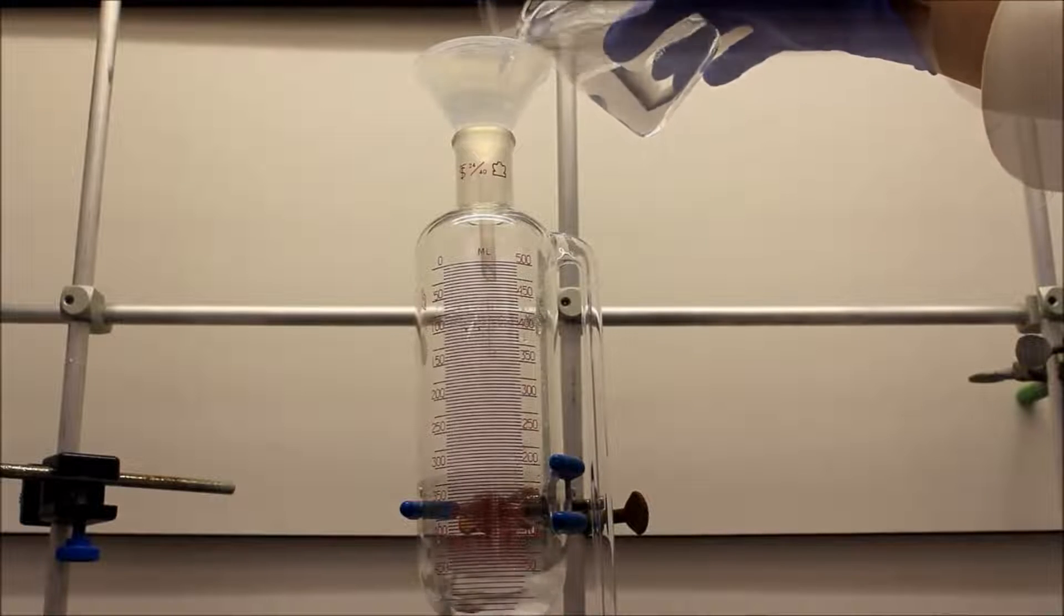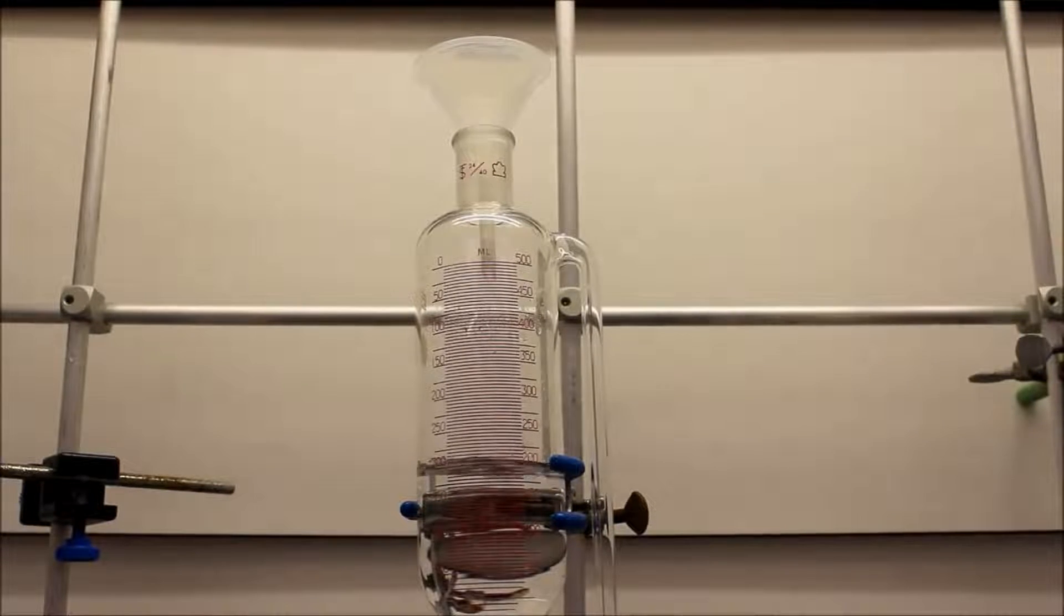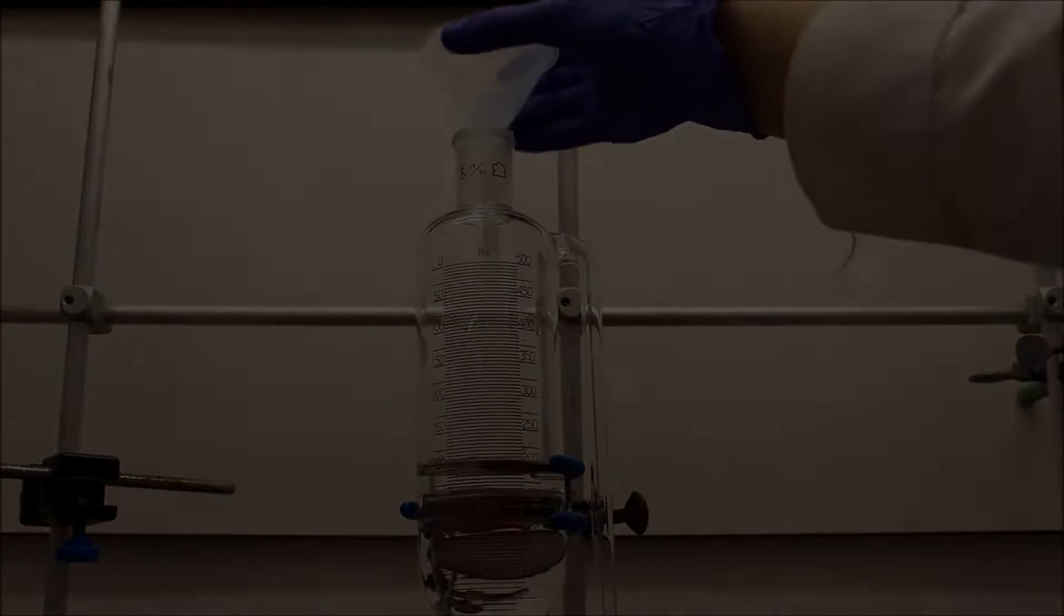Ensure that the burette is covered at all times since the ammonia solution tends to evaporate.